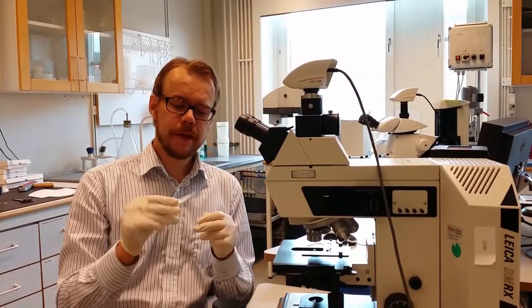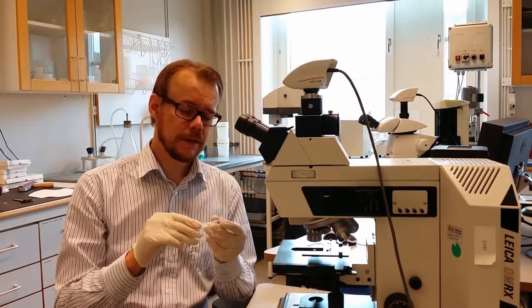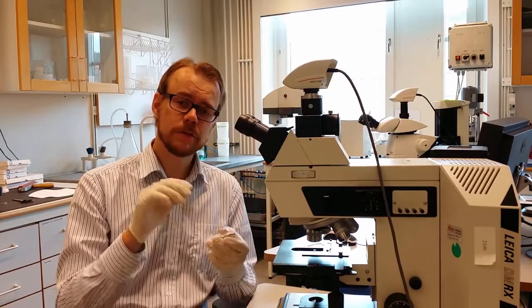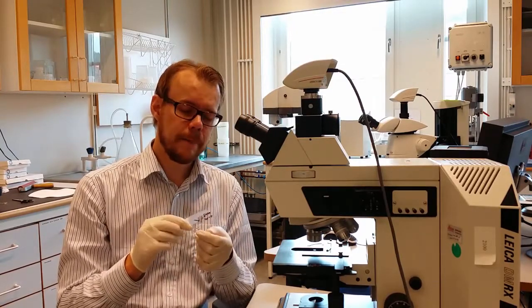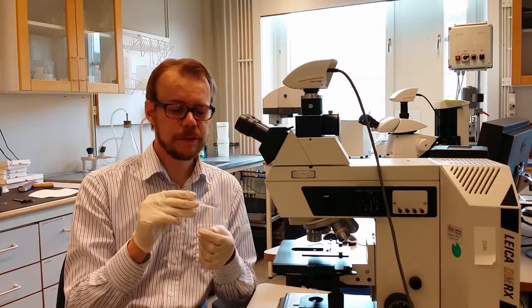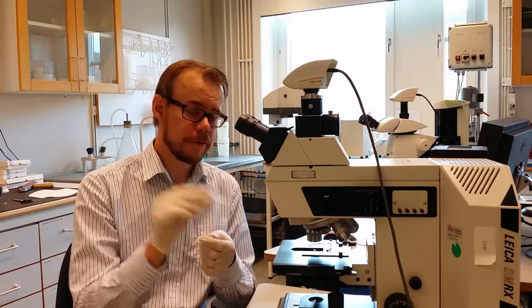I have already prepared a sample that's been ultramicrotomed. The sample is a paper that we cut in thin slices, and we're going to look at the cross section of that, because on top of the paper a printed silver nano ink pattern is made, and we want to study that. And the first step is to do light microscopy on it. So I already made this sample beforehand, and we're going to put this in.